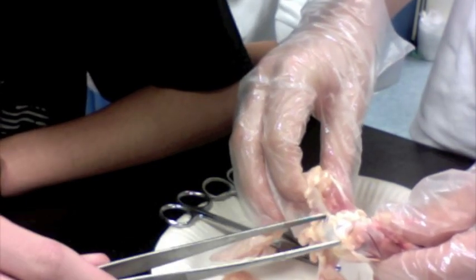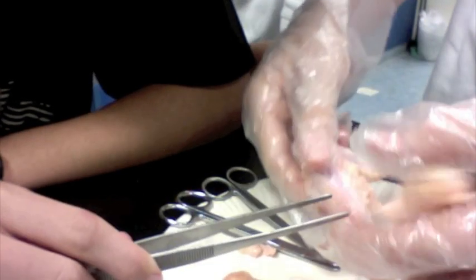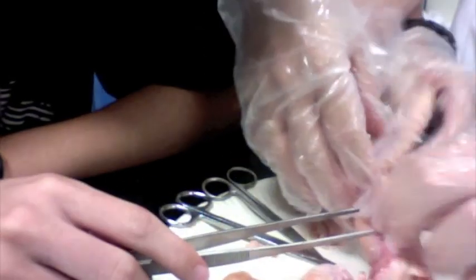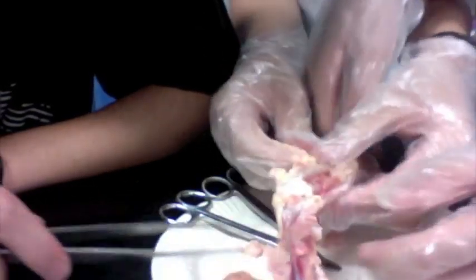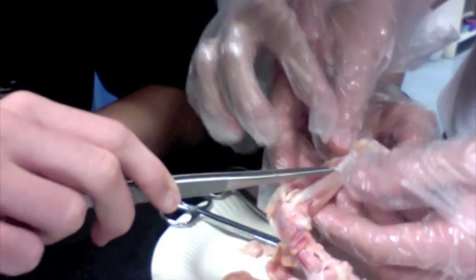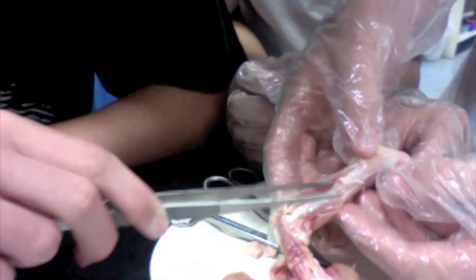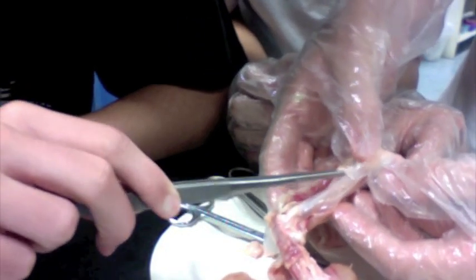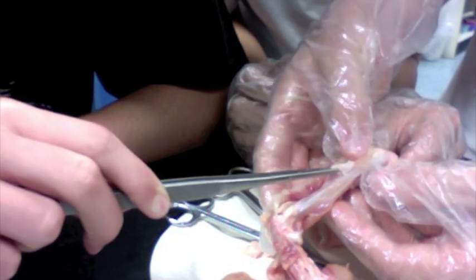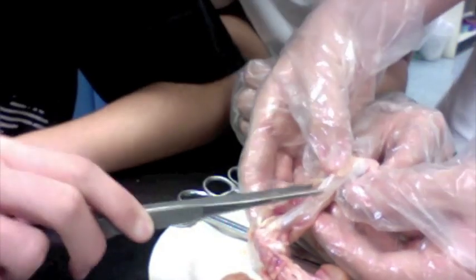Now we need to look at a tendon. Our tendon is right here. It's connecting muscle to bone, thus allowing the muscle to move the bone.